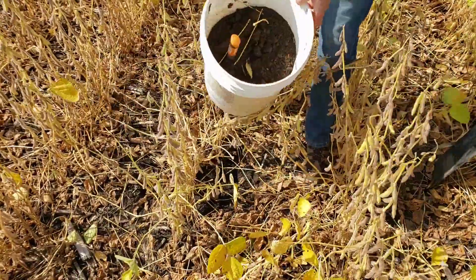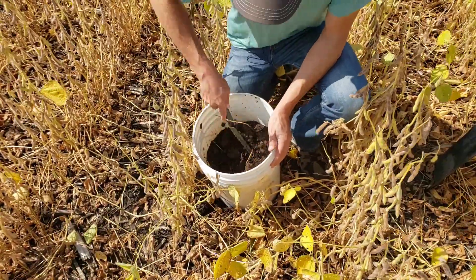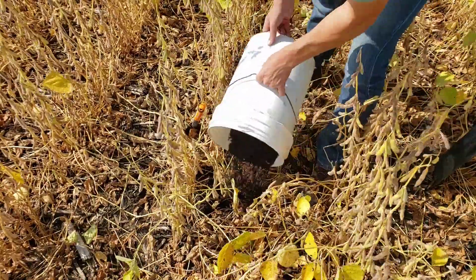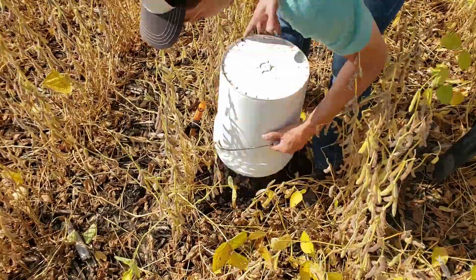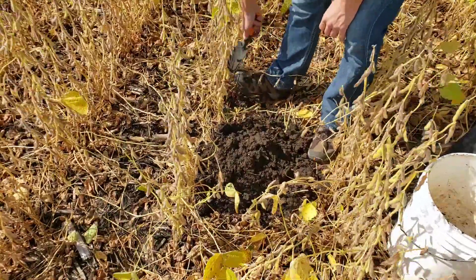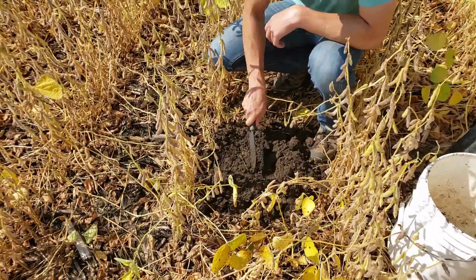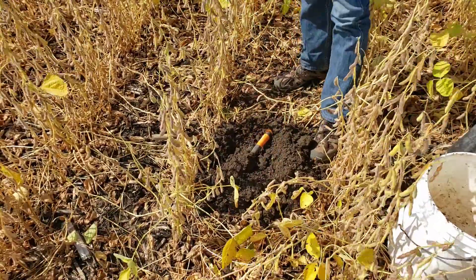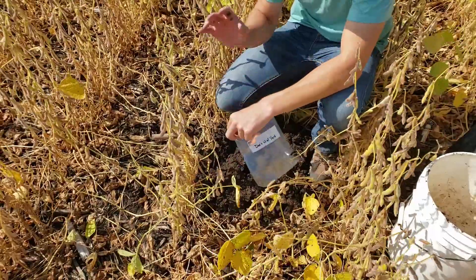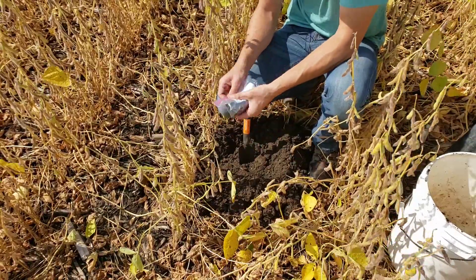I've got five spadefuls in here, and every time I put one in, I tried to mix it together and break up the clods so we're getting a good sample across the whole field. I'm just going to dump this out right here and mix it a little bit more, look for a good sample that constitutes a good mix, then put a little bit in the bag. I want to fill this three-quarters full with all 20 samples, so I'm only going to put a little bit in here and go on to the next one before shipping them in.